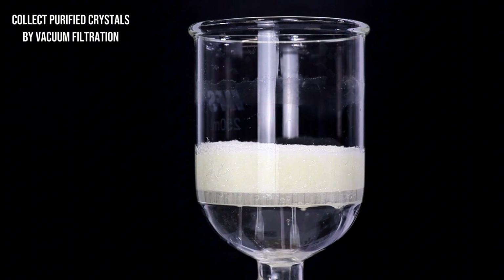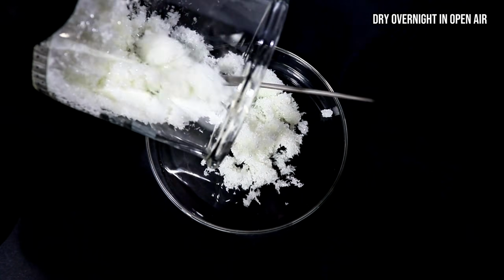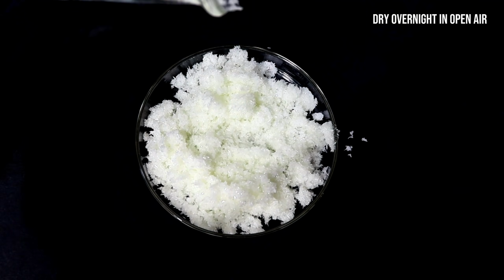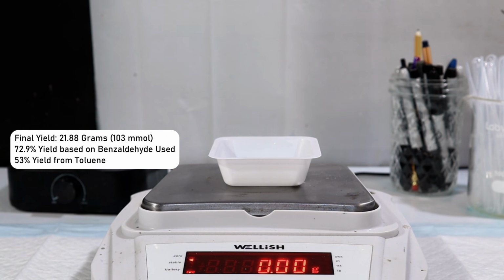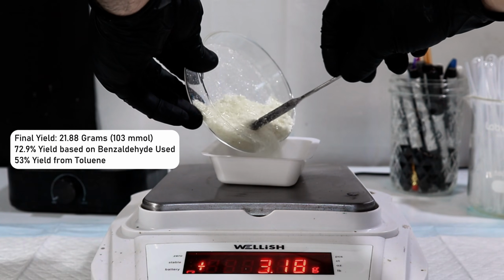By the next day, the benzoin was completely dry, and so I weighed it for a final mass of 21.88 grams, which represents a 72.9% yield. I think this is pretty good, particularly since I didn't have to use any cyanide to get here. The final product is this beautiful white crystalline compound. It melts around 137 C, which matches the literature value for benzoin.